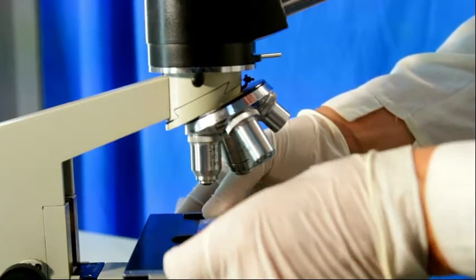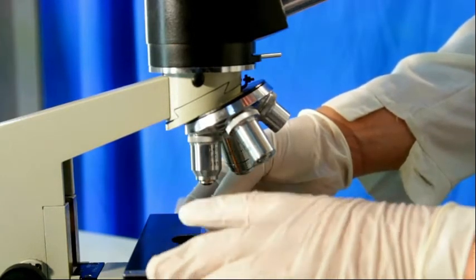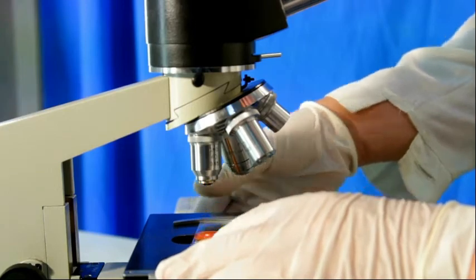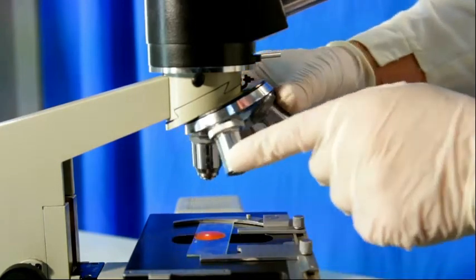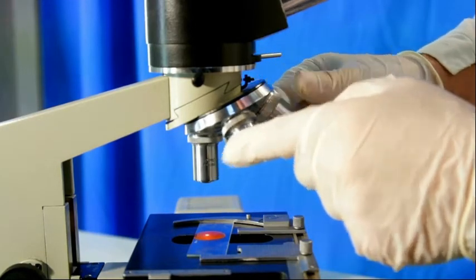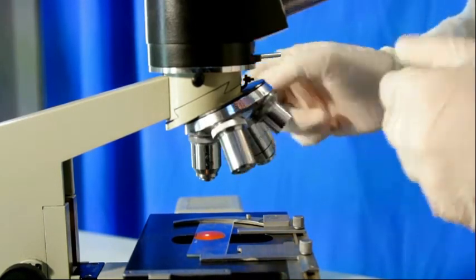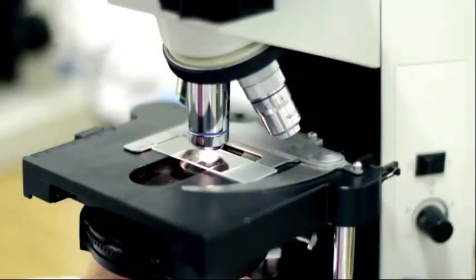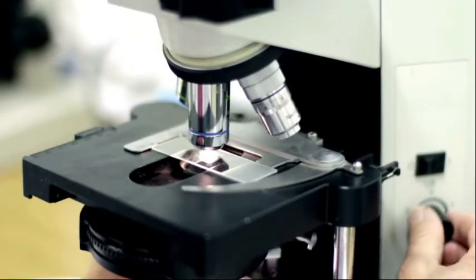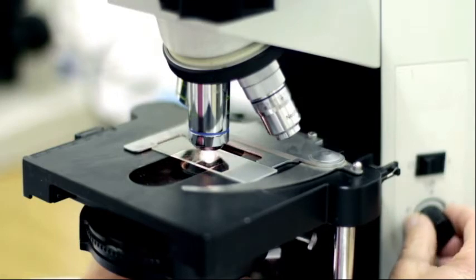The handle or arm is the part used to carry the microscope. The condenser consists of a powerful lens which condenses the light rays coming from the plane mirror and directs them to the object under observation.